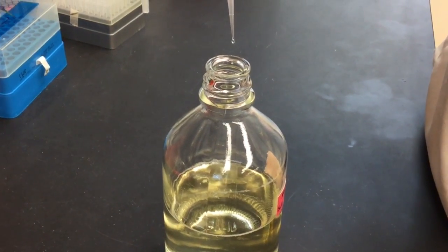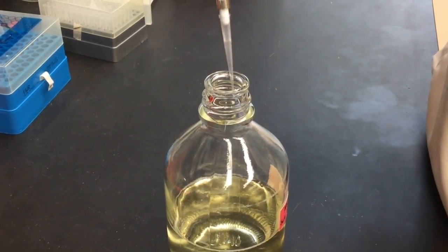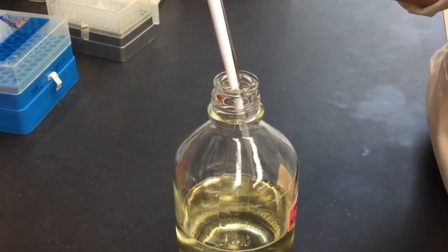Check the tip of your micropipetter to make sure all of the fluid is expelled. If you see a drop hanging on it, put it up against the side to make sure you have released all the liquid.